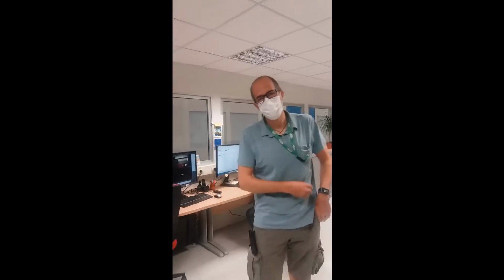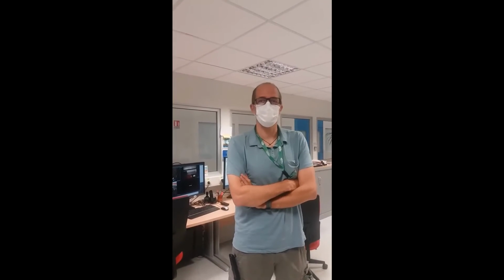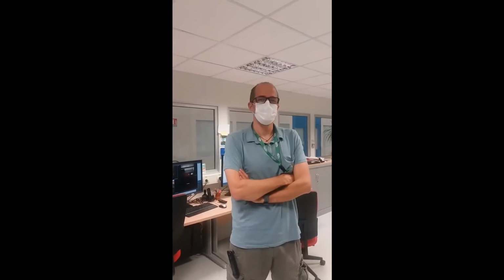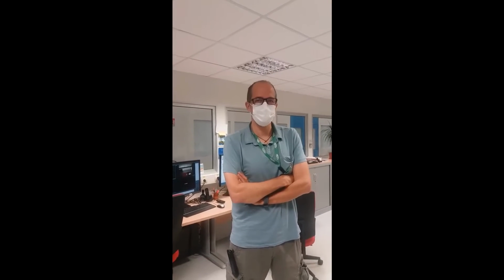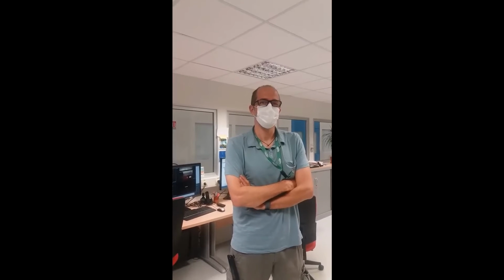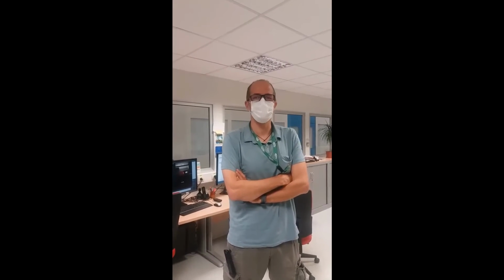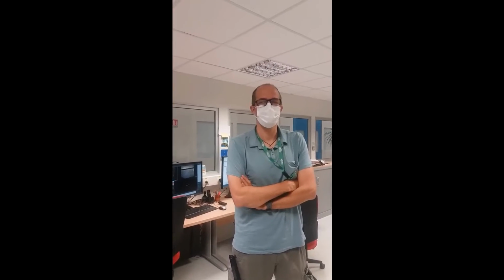So I'm Jakub Drnek, I'm beamline scientist here. I'm a physical chemist actually. So it is quite a unique instrument. This is a very high X-ray energy instrument that typically works at energies between 40 and 100 kiloelectron volts.